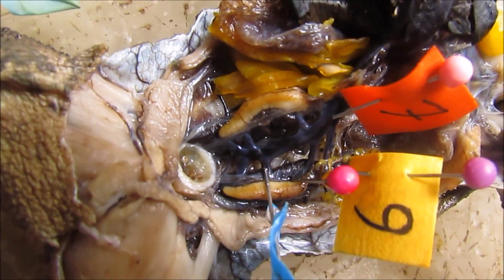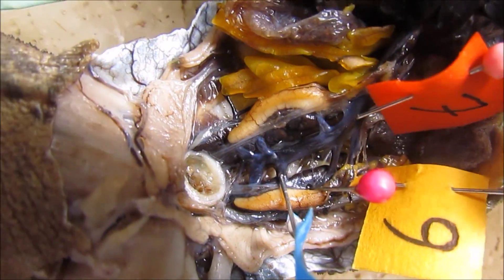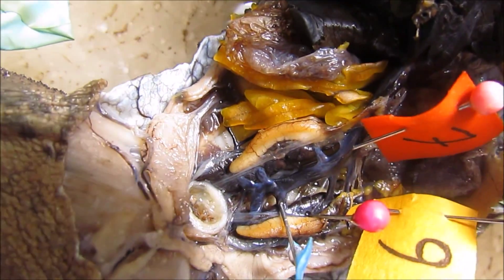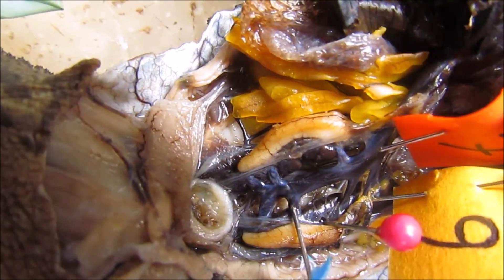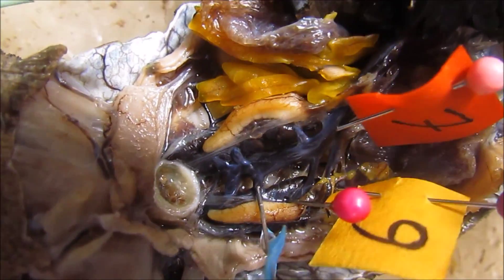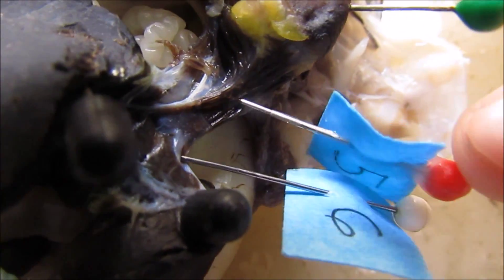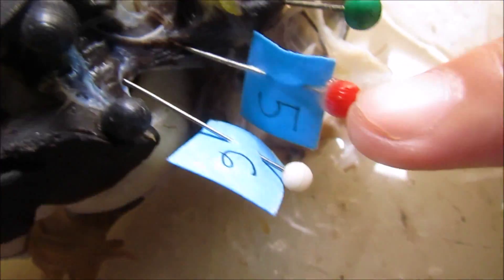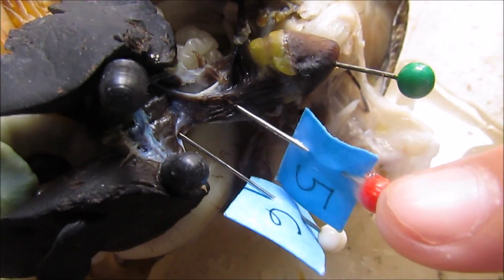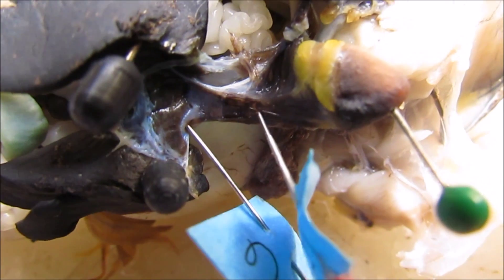And then the last one is the kidney, this one. So the postcaval is the big one — the branches: the renal, and then the liver, the organ. Kidney.